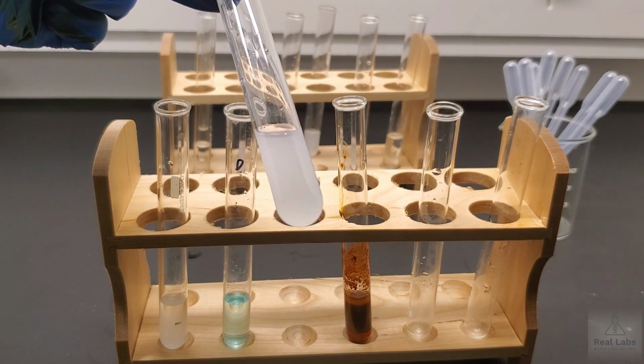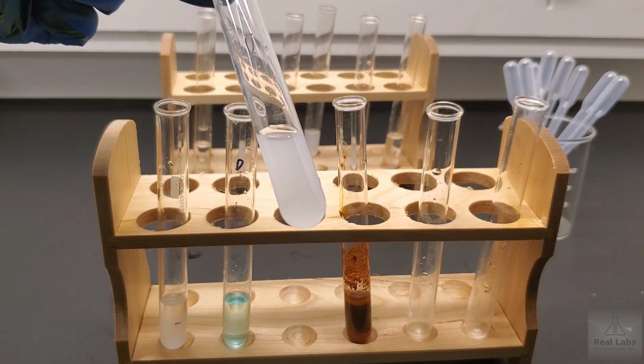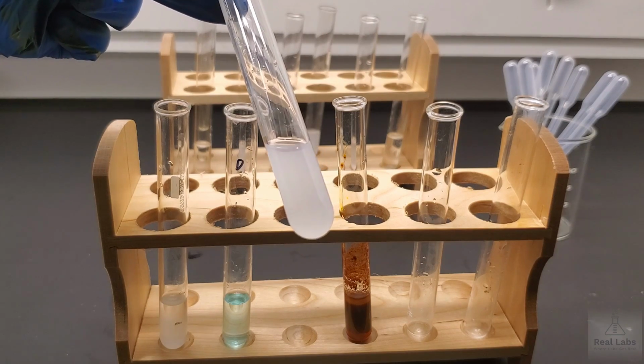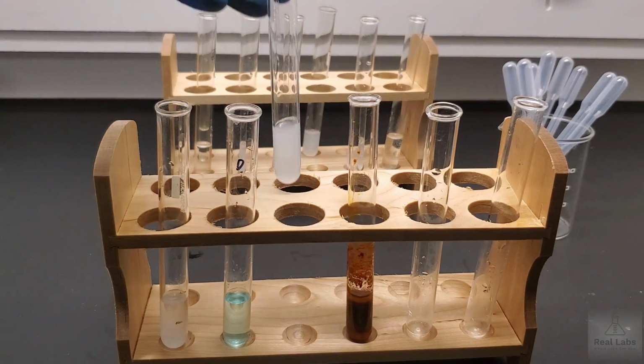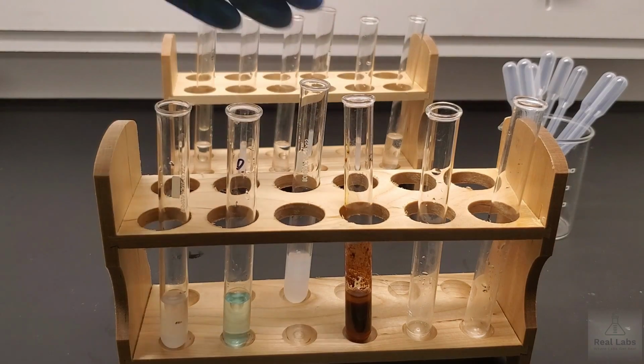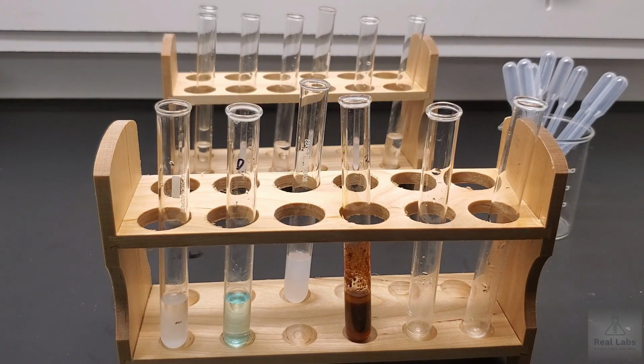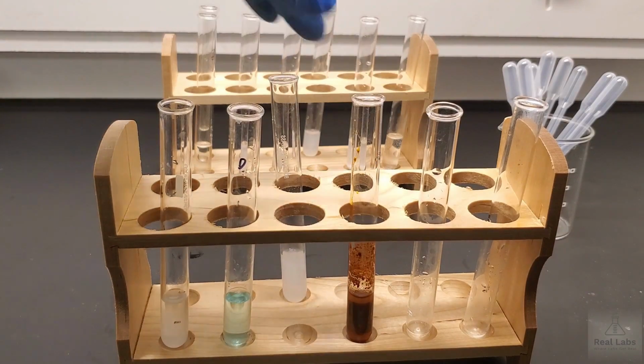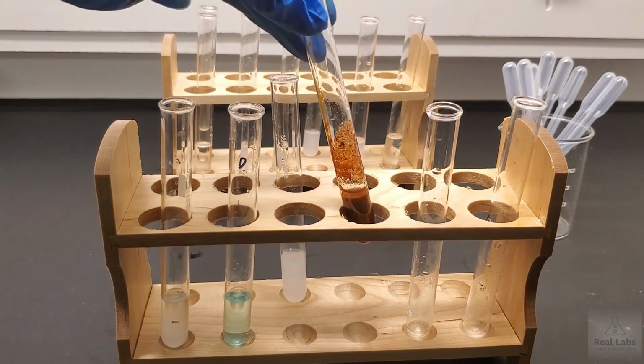So since we had two reactions now that didn't occur as expected, the first one being sodium hydroxide and hydrochloric acid, the second one sodium hydroxide and nitric acid, I had a suspicion that the sodium hydroxide system wasn't pure, or was contaminated with something. So we'll come back. We're actually going to rerun both of those in a moment.